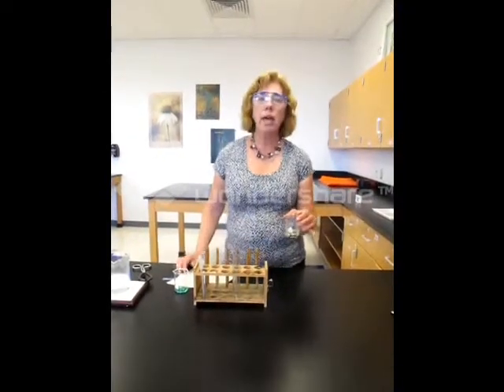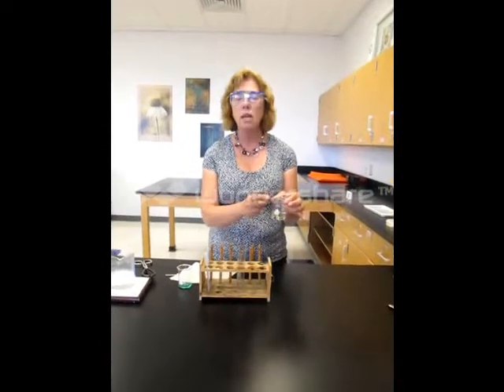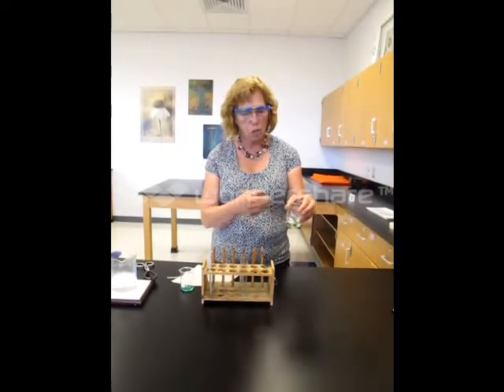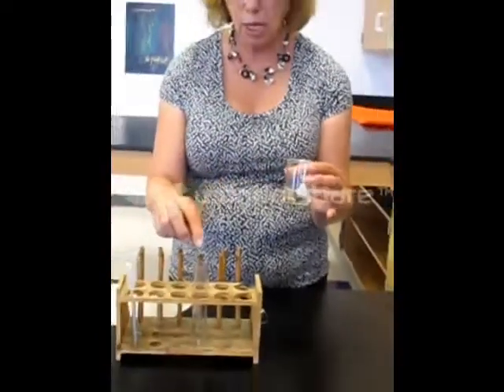Sometimes in science we may have added some material into a solvent, but not all of that material may go into solution. We have a really exaggerated example here where I've got some rocks in a water solution, and if I were to stir those up I could get those rocks suspended, but they're going to immediately settle out. Sometimes what I want is just the solution above that material that is not dissolved, so I might need to decant that material and collect the supernatant — just that liquid portion — in another container.